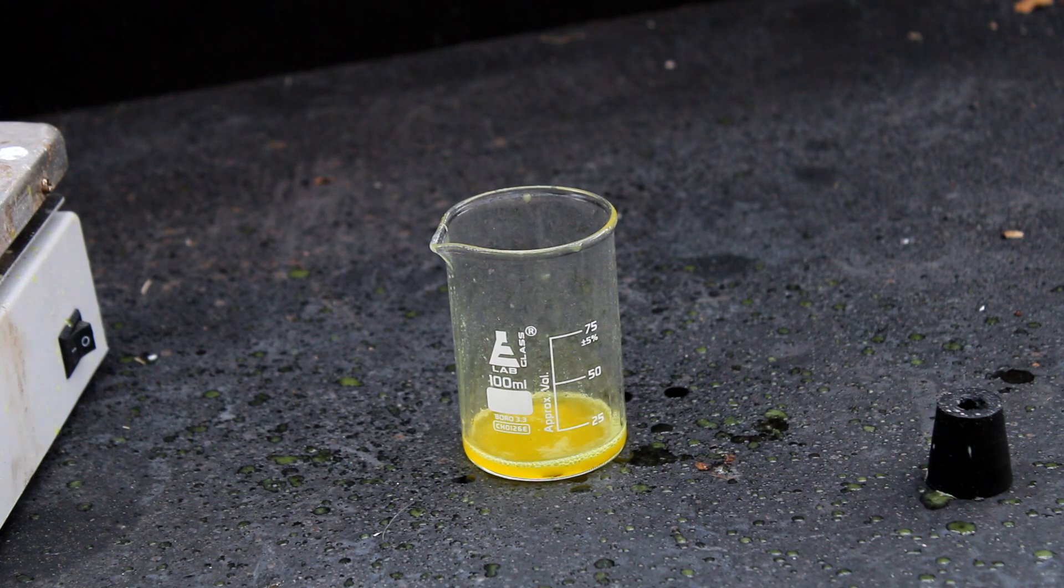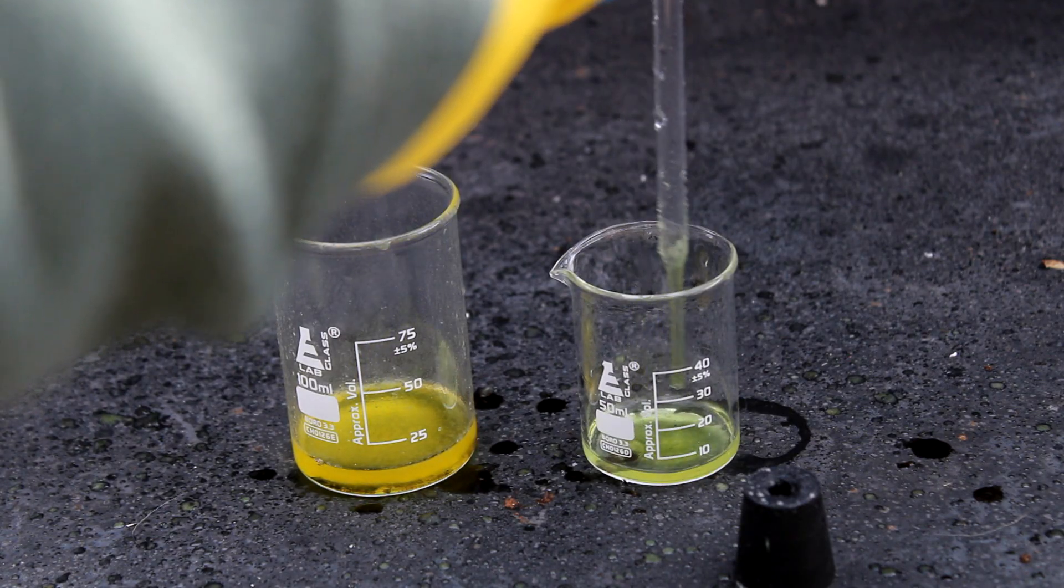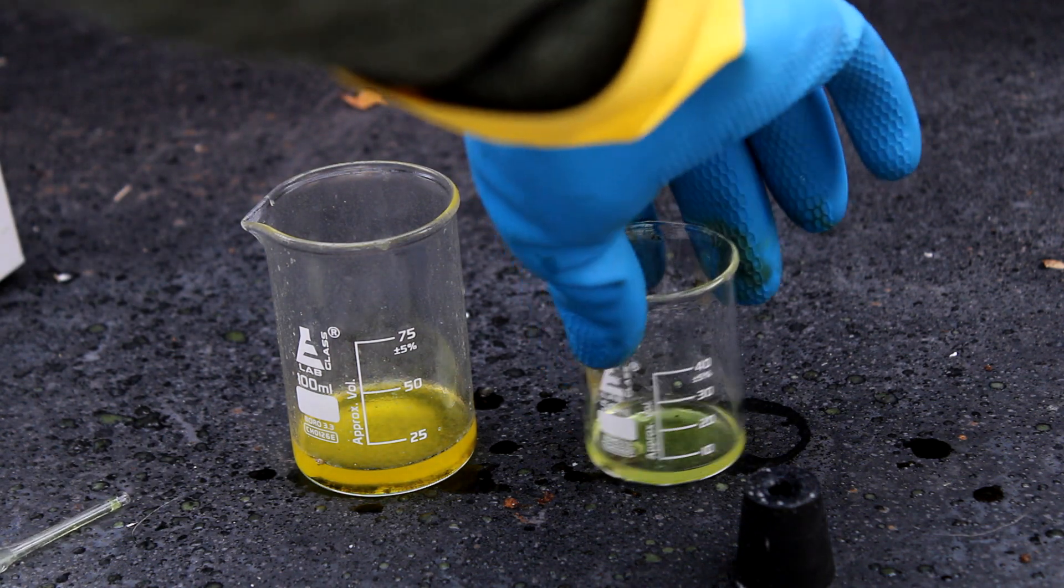Okay so let's stop just looking at it and try a few more reactions. First up, let's try methanol again. This time, we can see some liquid wicking up the sides of the beaker. This could just be the methanol, but it might also be some kind of reaction product. Probably not, but still.